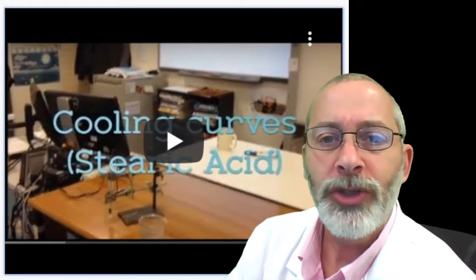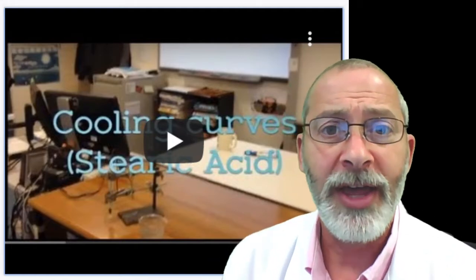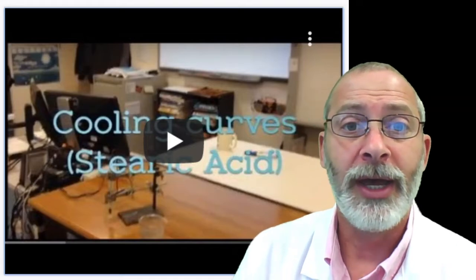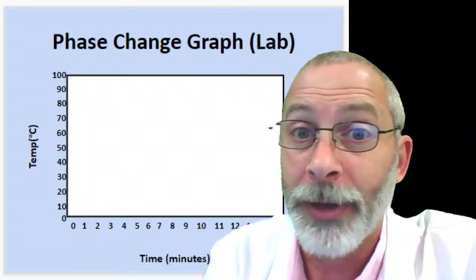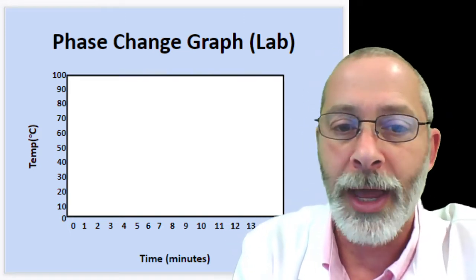All right, so back to our lab. Again, he was using stearic acid, but I have found that paraffin wax actually works much better than this under a shorter period of time in our lab. So here's what I'd like you to do. And by the way, I hope you were listening to what he said as we do our own lab.